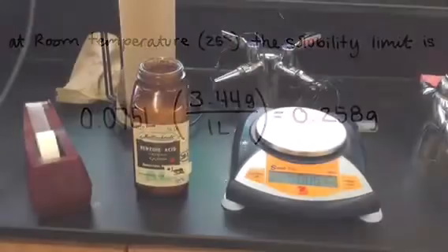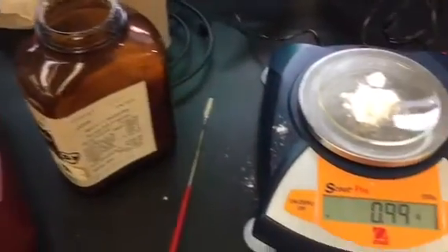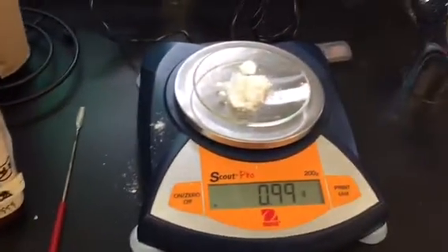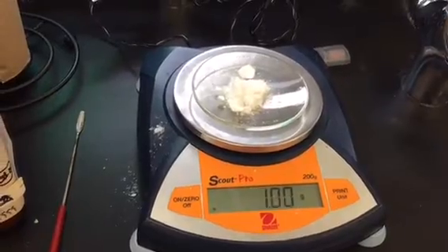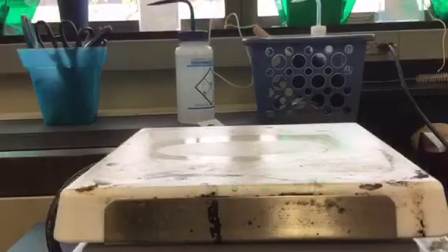With the addition of heat, more energy is put into the reaction. This allows for more benzoic acid to be dissolved in the water. In this case, I dissolved 1 gram of benzoic acid in 75 milliliters of water.